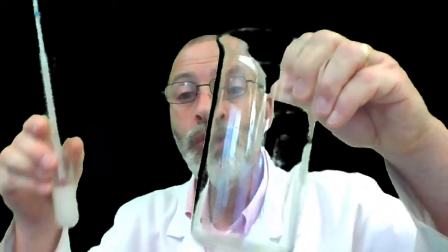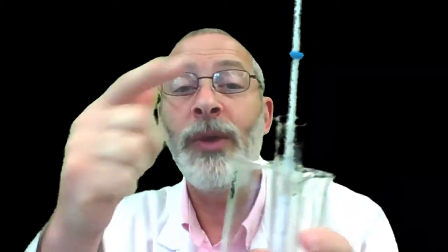And as you can probably imagine, boiling water around this test tube warms up the test tube. The heat energy is absorbed into the wax, and the wax melts so that it becomes a liquid. And we have a thermometer in the test tube, and we record the temperature of the hot liquid wax. And then we take that test tube of hot liquid wax and we put it into a beaker of cool water, and we watch what happens to the liquid wax, and we watch what happens to the temperature.